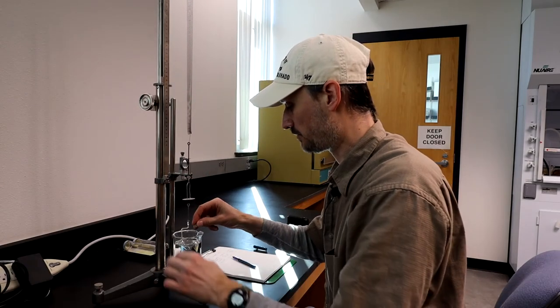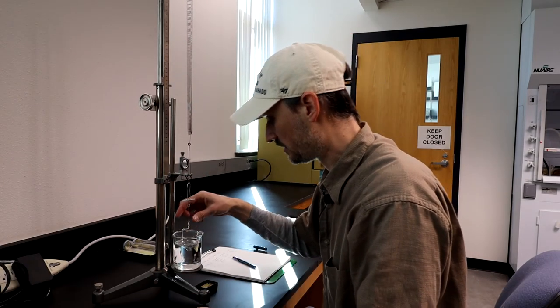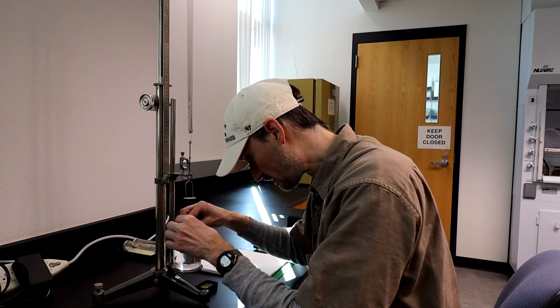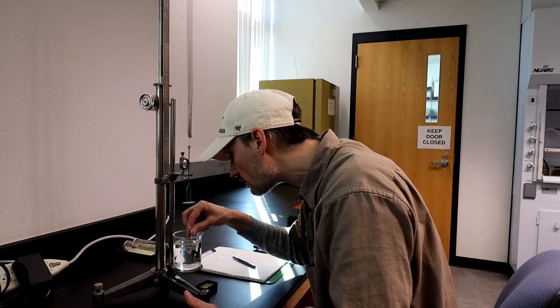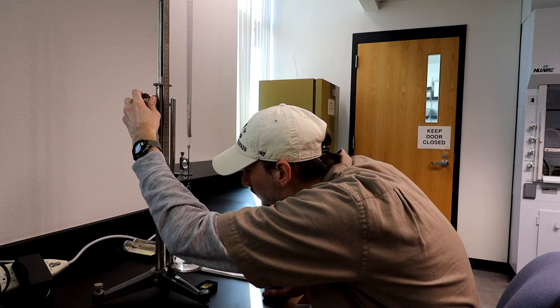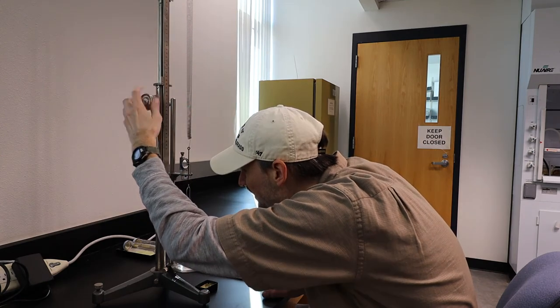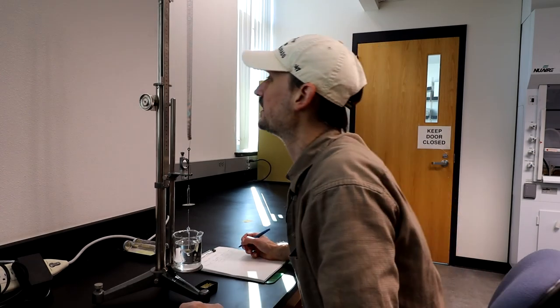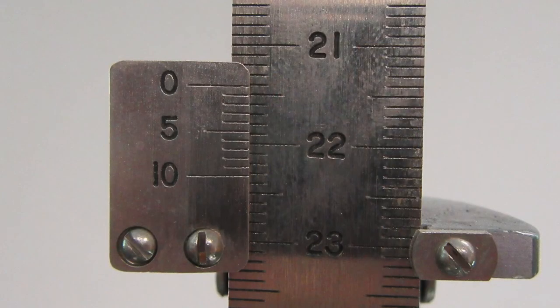Move it from the upper cup to the lower cup. There's an air bubble on it, so I'm just going to—there we go, that got it. Make sure there's no air bubbles on it, bring it back down, and read it off: 21.42.